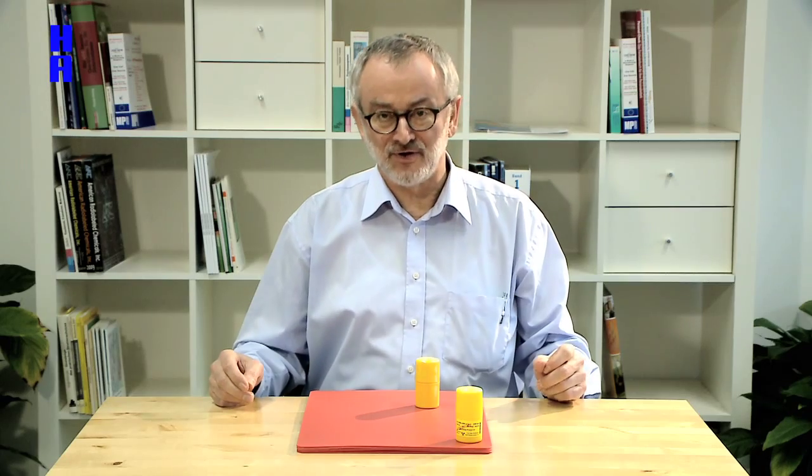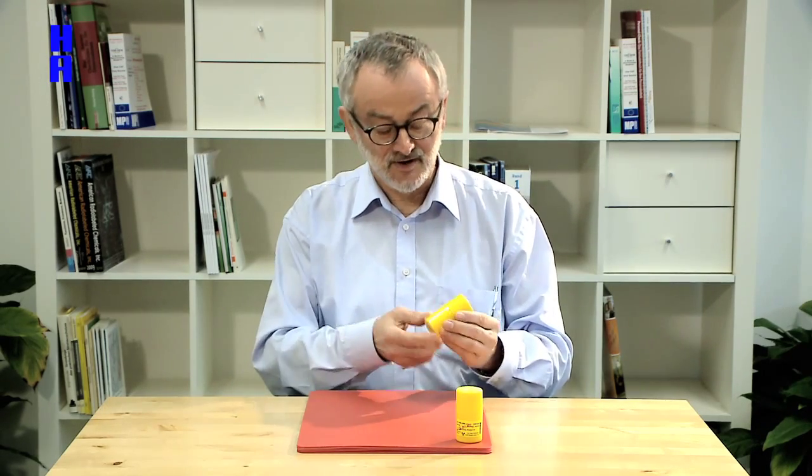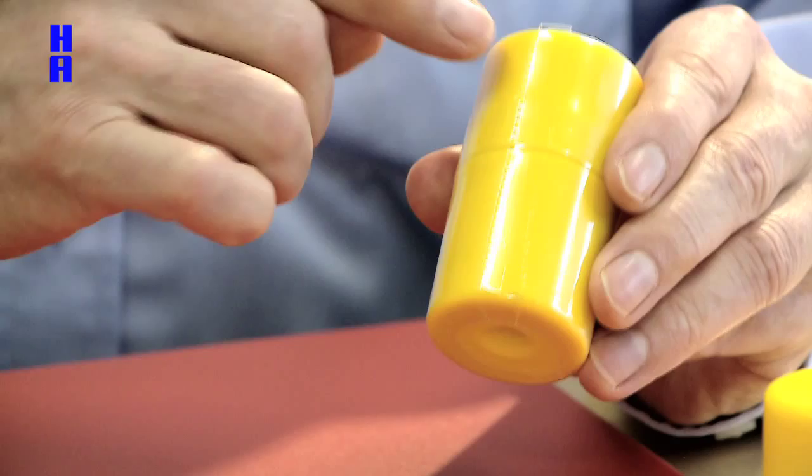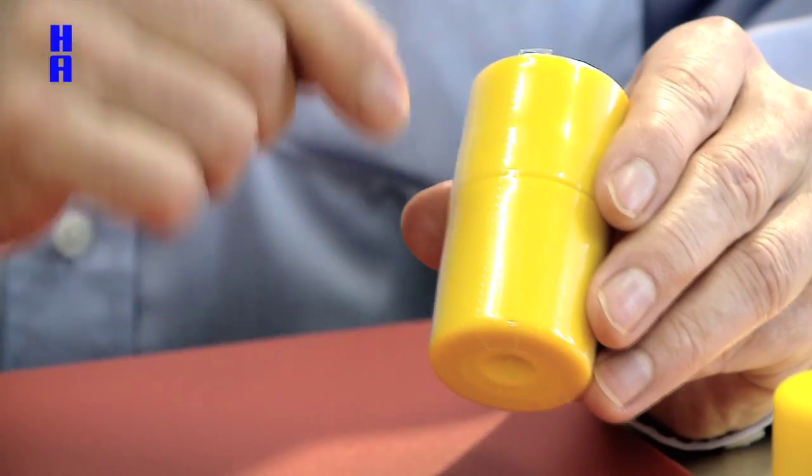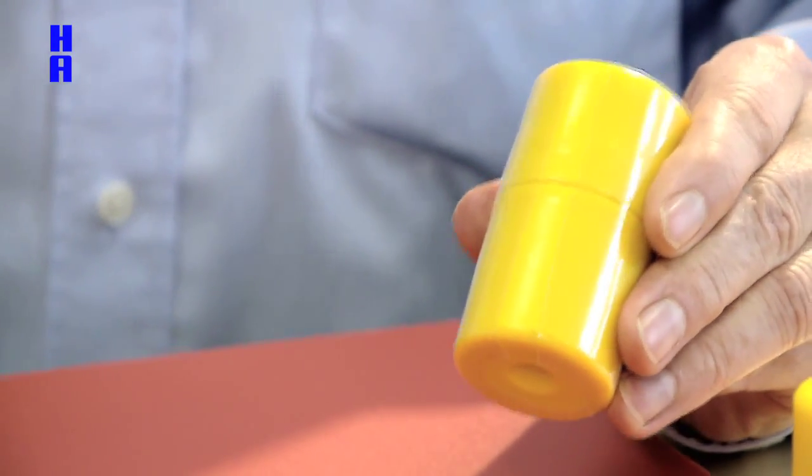Now we want to show you how easy it is to open one of our yellow containers. You get it like this, you see the perforation over there, it's as easy as that.